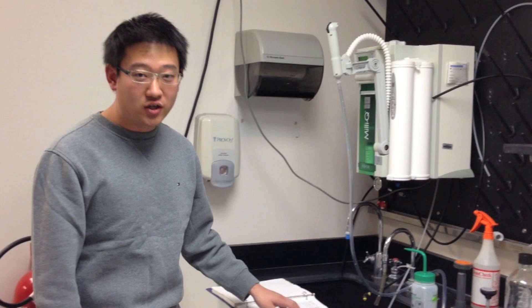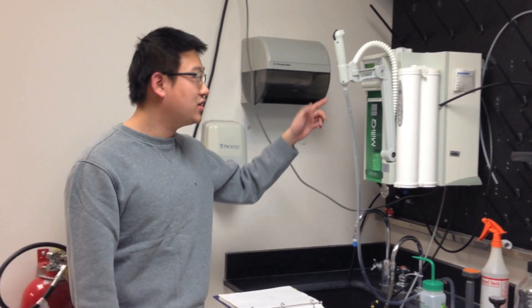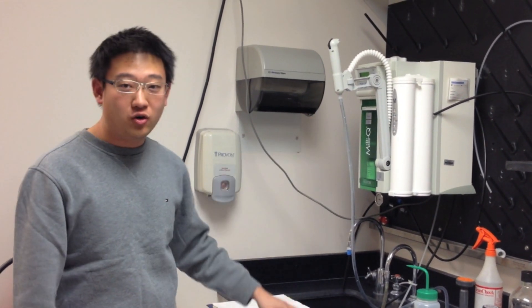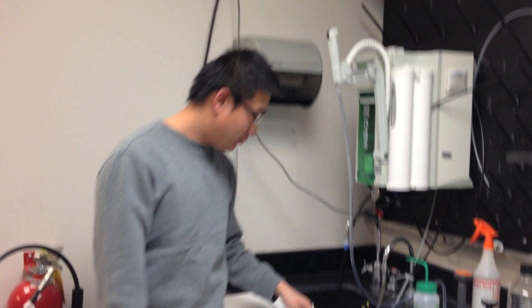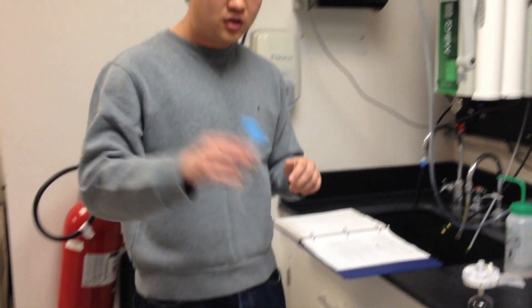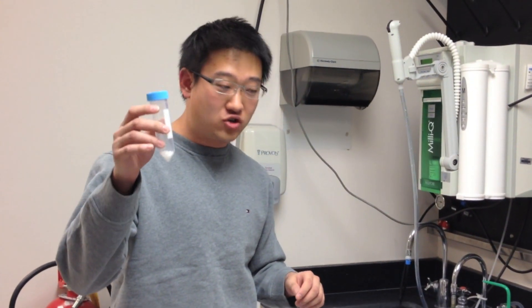Hello, I'm going to introduce how to do the sanitation with this Millipore water machine. Before you do the sanitation, you will need 3 grams of sodium hydroxide.